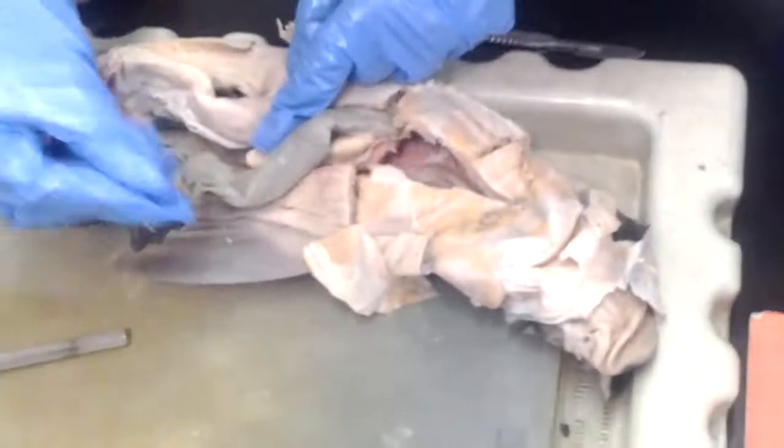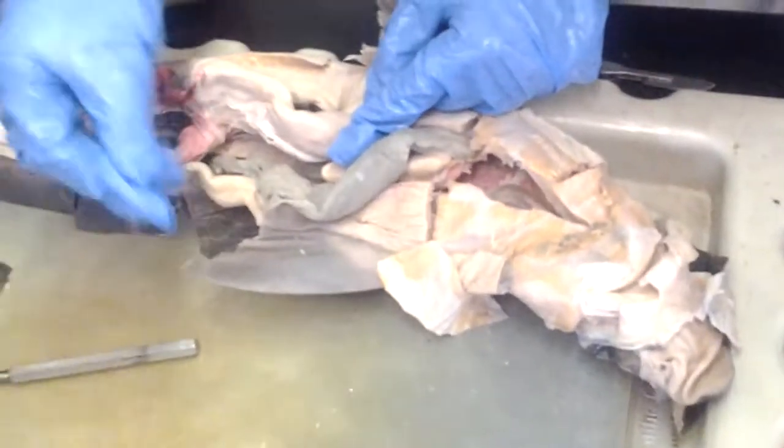Do you have a tweezer? I do. Oh, good. Okay. Yeah, I just need a tweezer for a second.